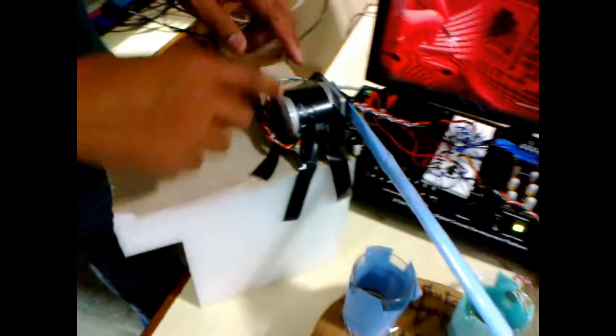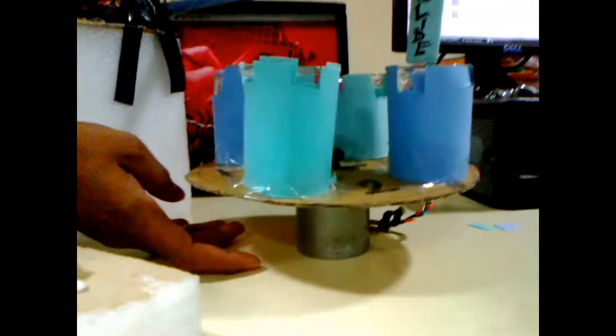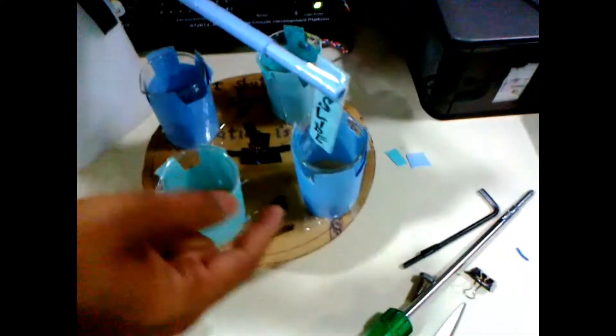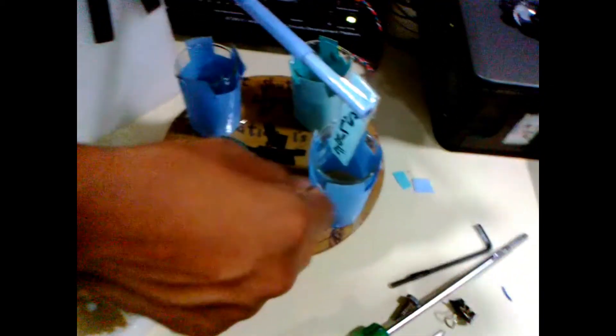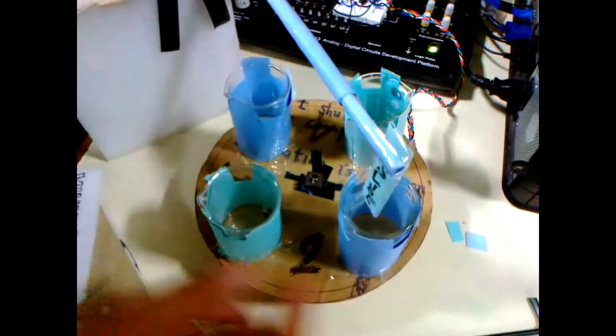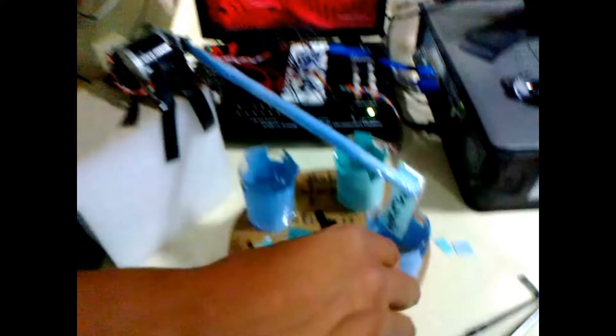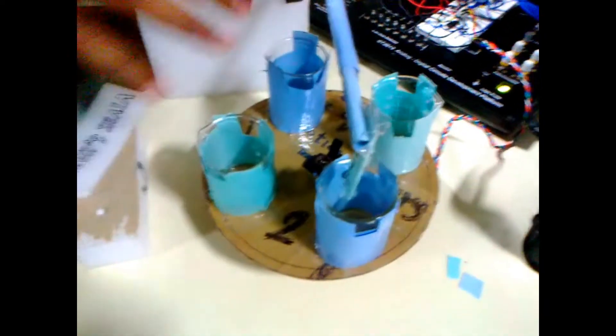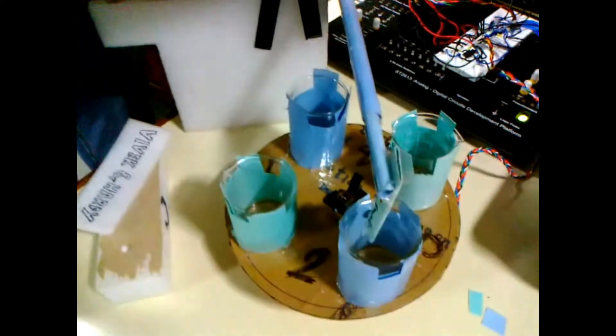Here you can see the setup of the motor. We have used two stepper motors: one for lifting and dipping the slide, and another for rotating the beaker. The beaker is filled with the solution, and simultaneously the robot arm dips the slide inside the beaker for 10 to 20 seconds, depending on the requirement of the SILAR process. The time varies continuously, so we have programmed a time-varying sequence that controls both the robot arm and the beaker rotator. These two motors are calibrated simultaneously according to time.